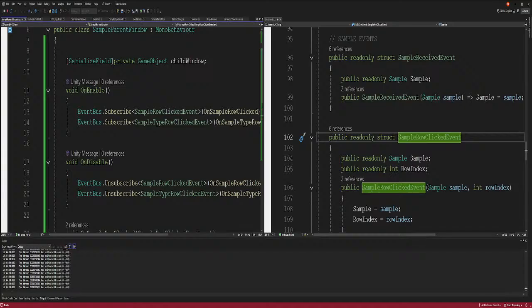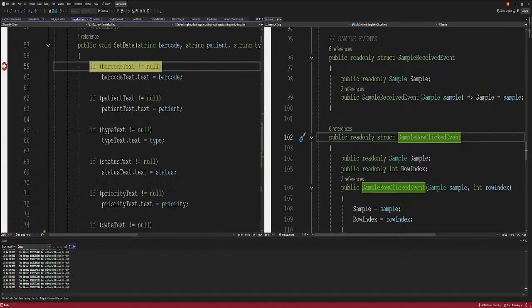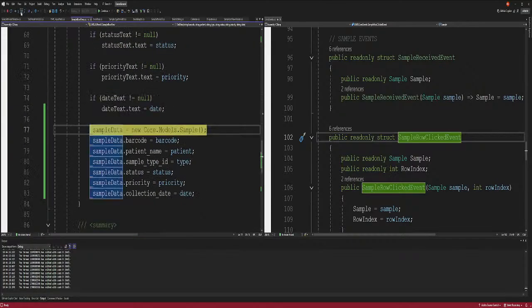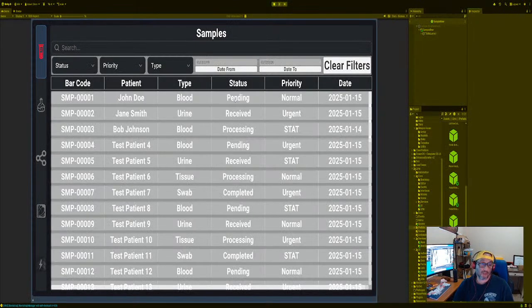So is this booting up yet? No, not yet. Right, and then we see after that how that looks. So actually, let's go back to the screen over here. While this is loading up, oh, it finally loaded up. You see, debug is crazy, man. All right, we got that. Now we did it without causing that error. We're not gonna go through all the things, right? There we go. Okay, so now we got the data again, right? Let's click one to see if we actually open one.